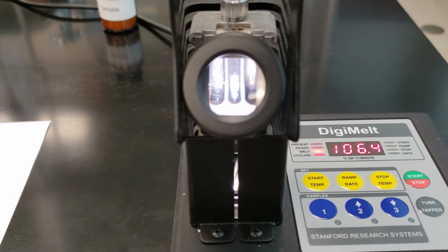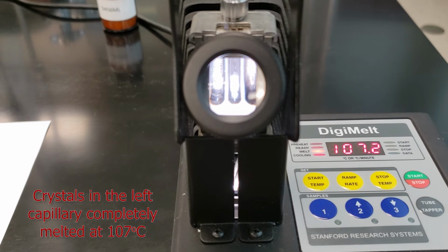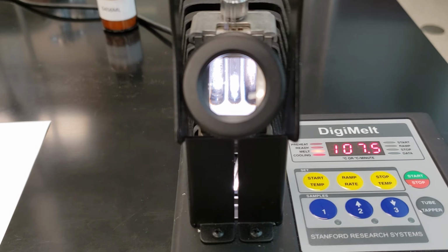We see continued evidence of melting on the left-hand side. Additional bubbles starting to form around our solid as it melts. So far, the center lane has remained solid, has not melted.